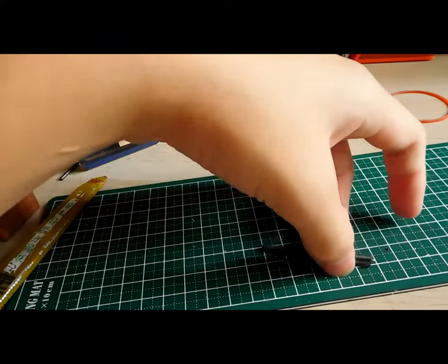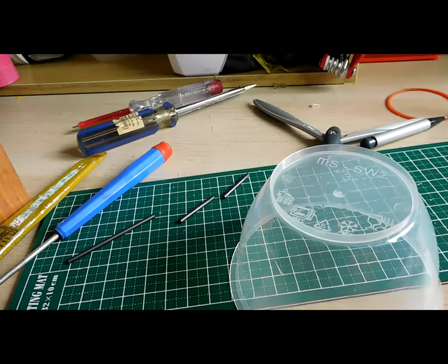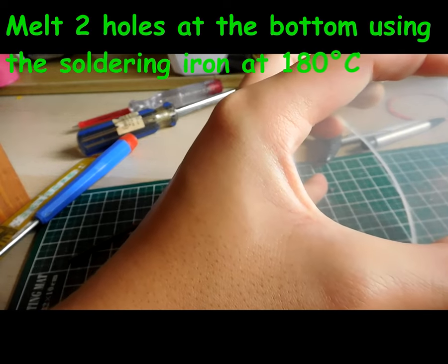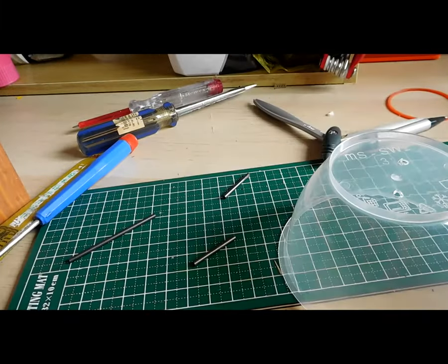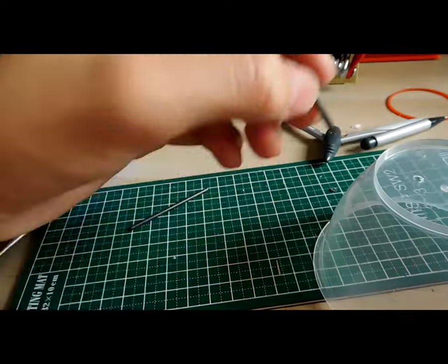To poke two holes underneath the container, we can actually use a soldering iron at 180°C, which is the minimum I can go to. Works pretty well, but be careful not to put your hands too close to a soldering iron.